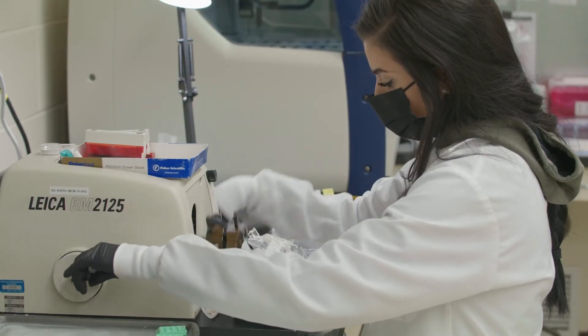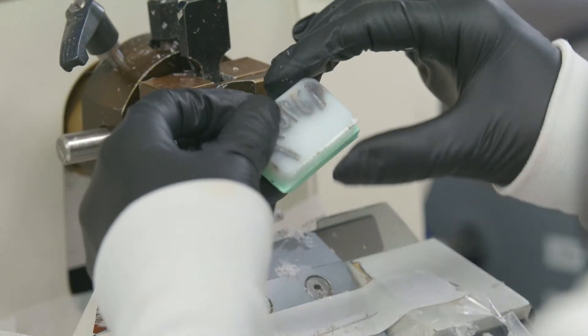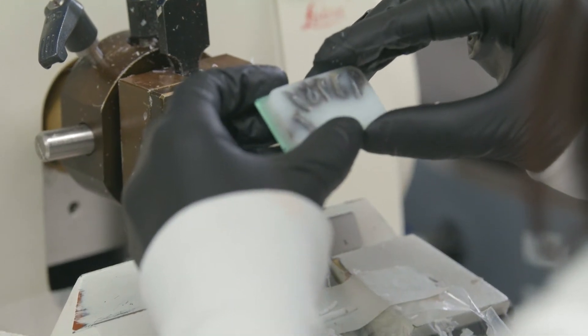With that I will now turn this over to and introduce you to Jennifer Finney, who is our laboratory administrator, and she will show you a bit more around the lab and some of the ways that we contribute here to the work of KSVDL. Welcome to the histopathology and immunohistochemistry lab here at KSVDL. My name is Jennifer Finney and I am the histology laboratory administrator. The histology lab processes formalin-fixed tissues and prepares tens of thousands of glass slides annually for microscopic examination for diagnostic, teaching, and research purposes.